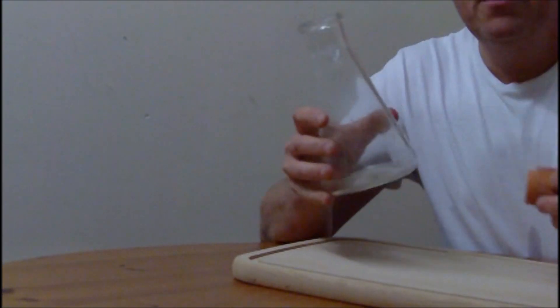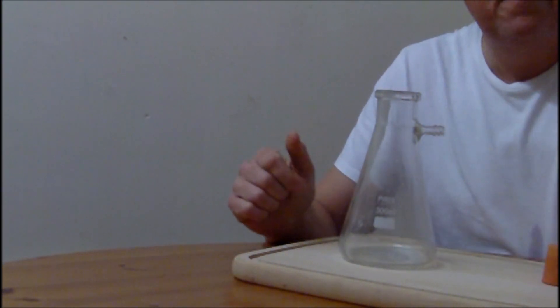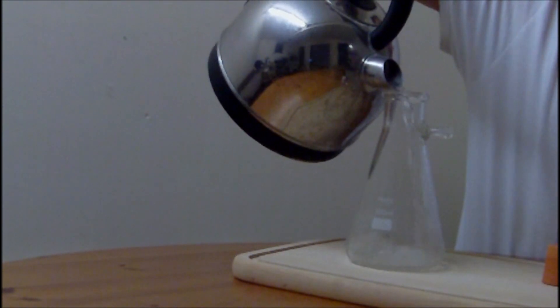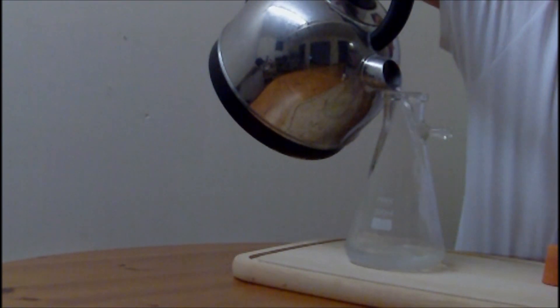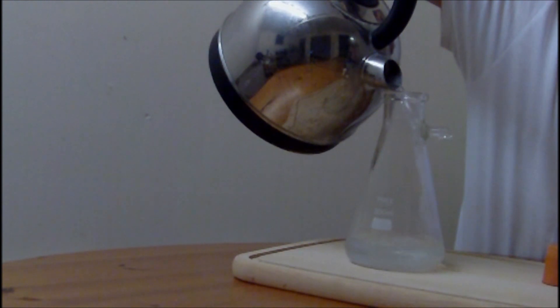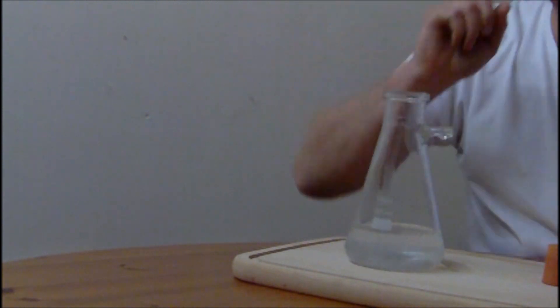So, here we go then. I'm going to take my container and I'm going to pour some hot water. I'm using hot water because it just makes it a little bit easier to dissolve my sodium hydroxide.